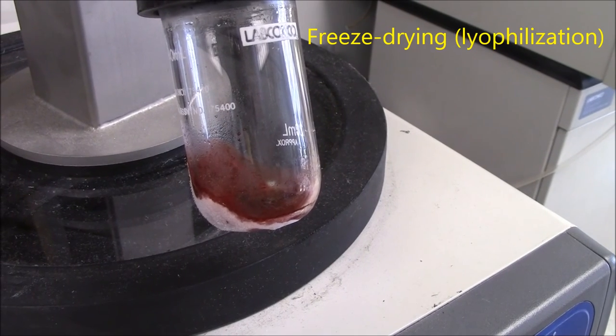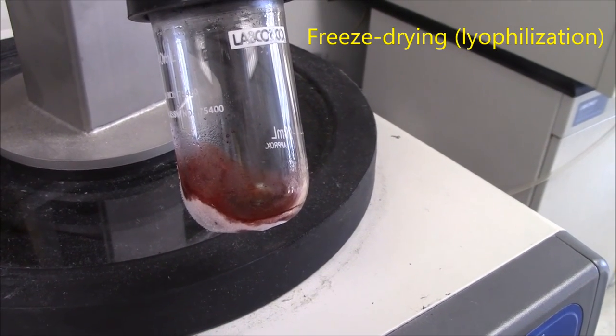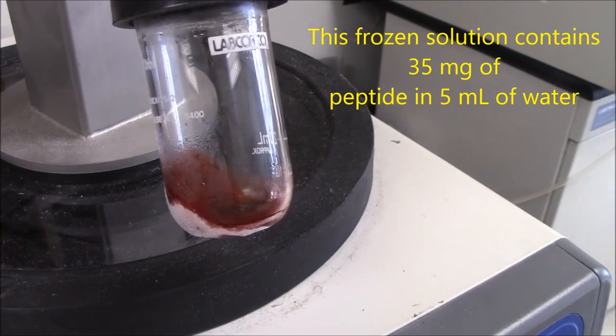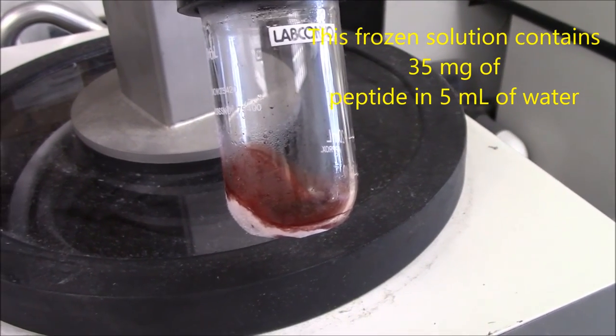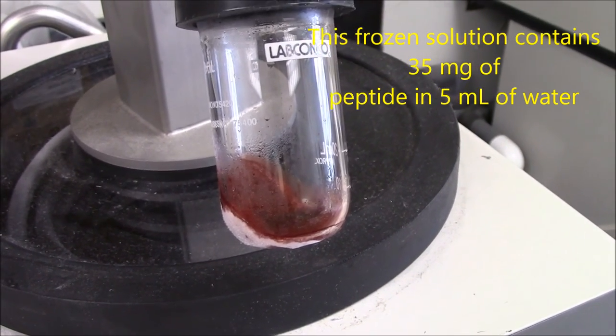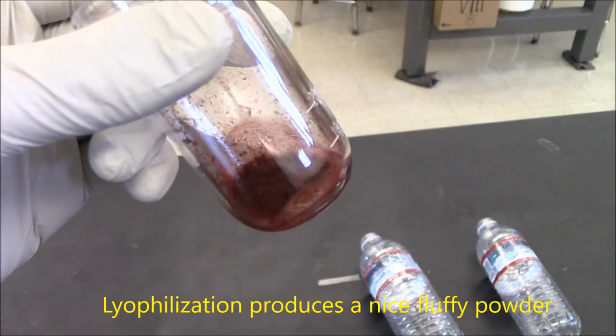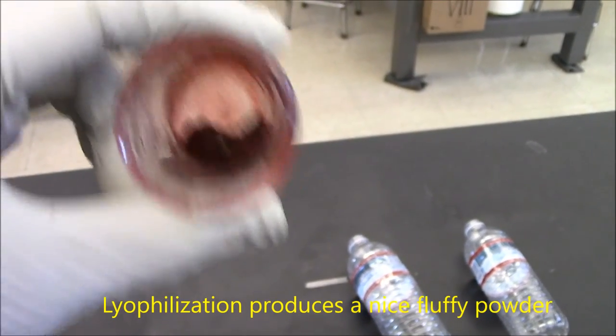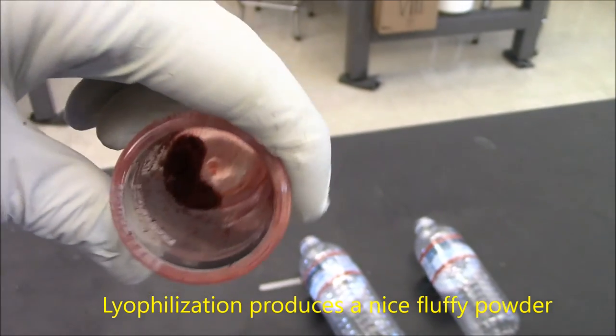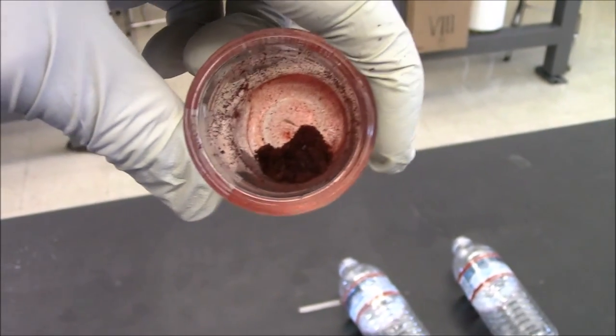Here I'm lyophilizing my final peptide, let it go overnight in the morning, I'm hoping I have a fluffy red powder. Here's my dry product, rather fluffy, and that's my peptide.